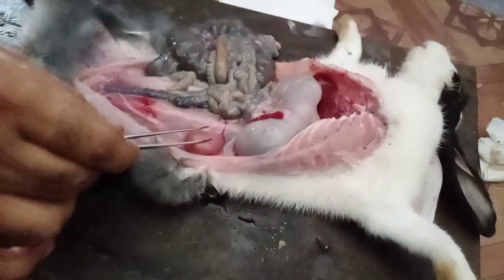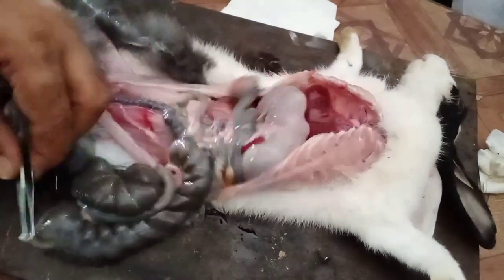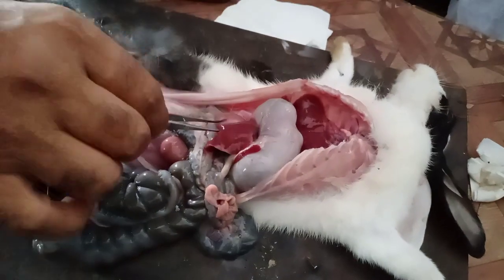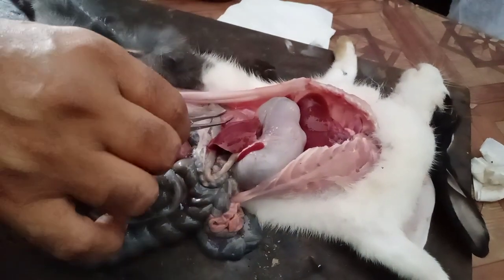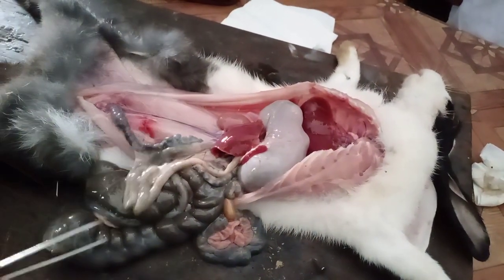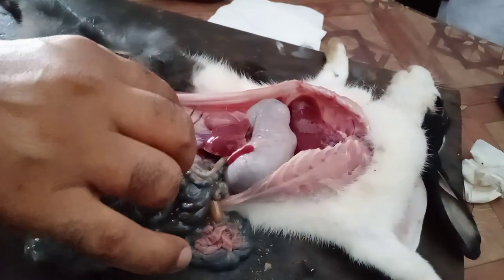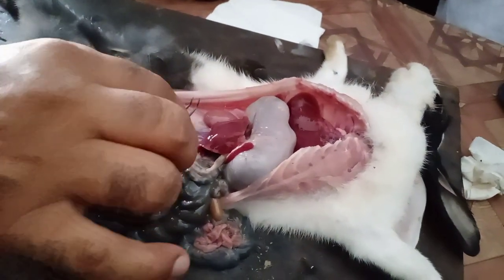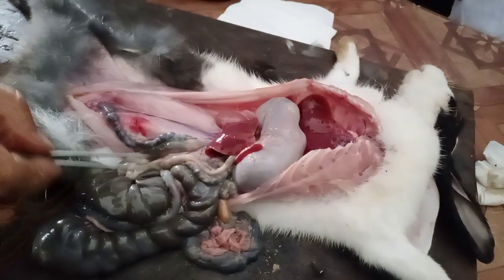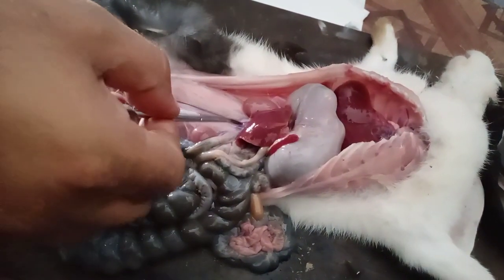This is the left kidney. And this is the right kidney — take notice that the right kidney is a bit higher in position, more anterior, as compared to the left one.